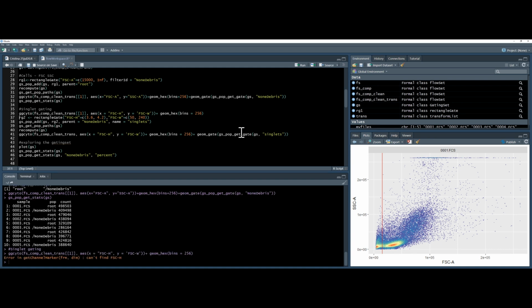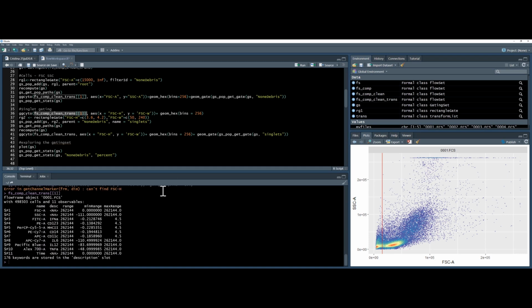And I have an error saying I cannot find my forward scatter height. Now why is that? If I highlight my file and press Control Enter, it will give me the information of my file, and I can see that this file does not have forward scatter height or width. In fact, it has no way to gate the singlets at all. So that's a little bit of a disaster. So I think we should just move on to the automated gating with a different data set.